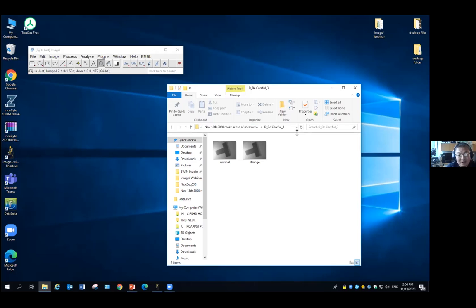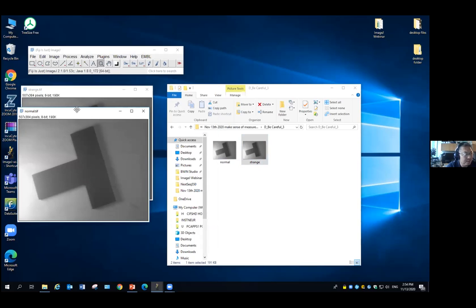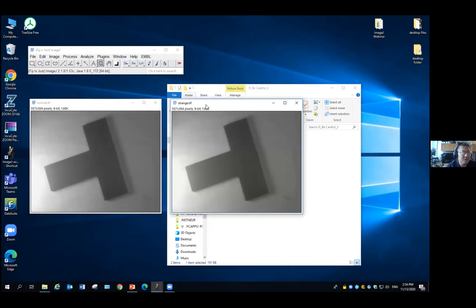Some software can do very strange things to your image, and you can't even notice it. This is just one example. If I open a normal one, this looks just like an image. Then I open a strange one. I'm not sure if it will work exactly the same on your computer. It seems to also depend on the specific computer setting. So I would say it looks the same.